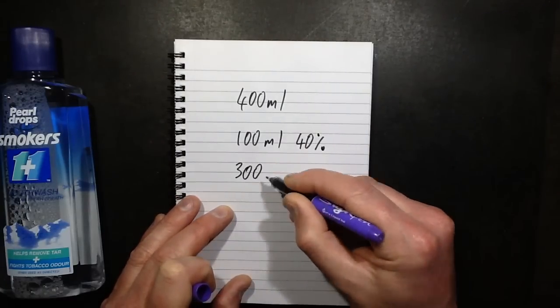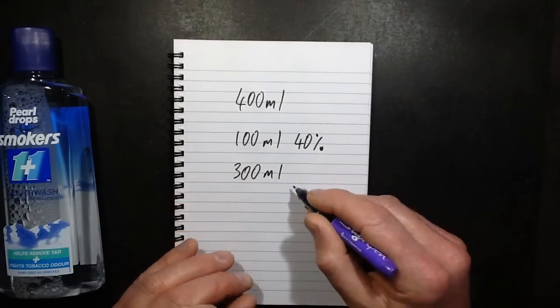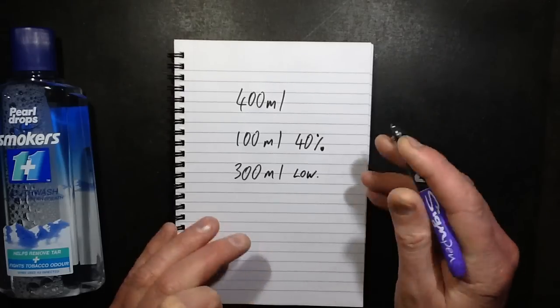And 300ml of very low percentage, so it's just really what's left.